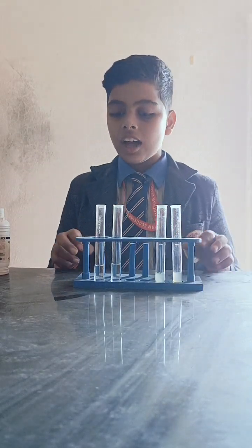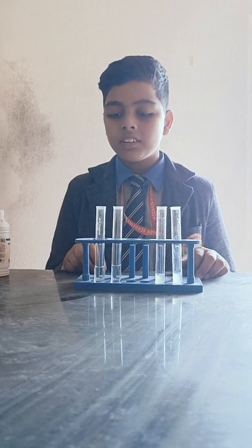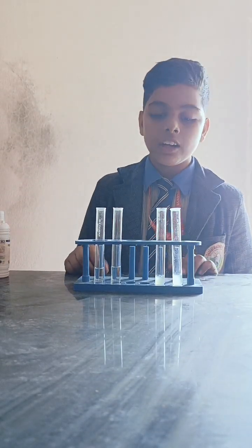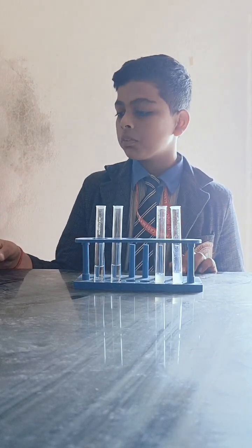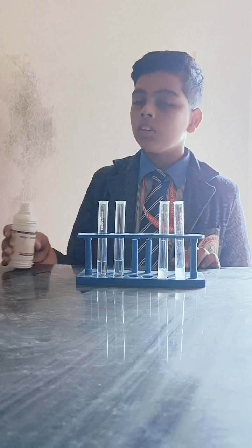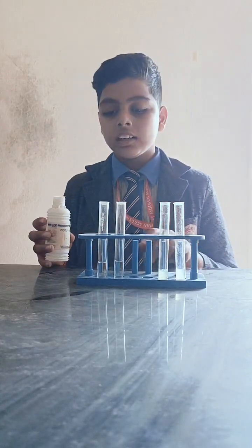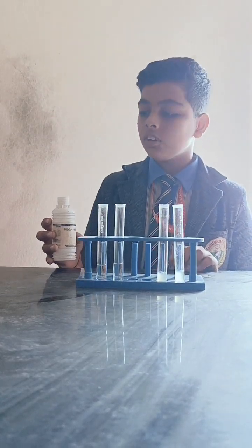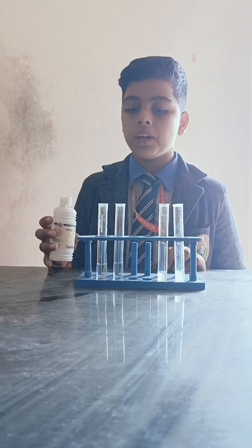So here I have two test tubes. I don't know which contains base and which contains acid. So I have two indicators: phenolphthalein and methyl orange. If we add phenolphthalein to acid, it does not change any color. But if we talk about base, then it turns pink.